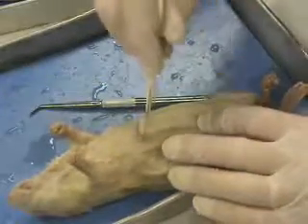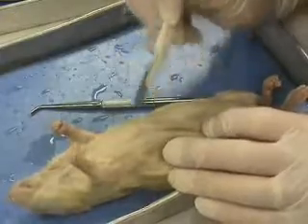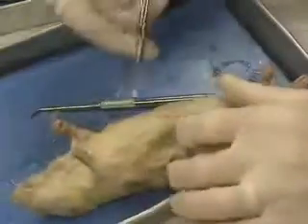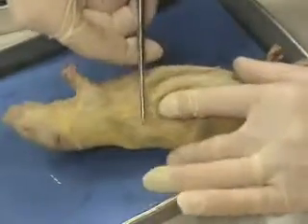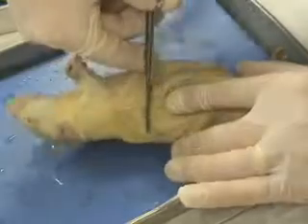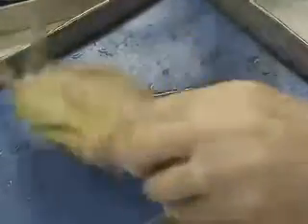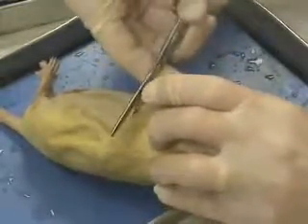and I'm going to make an incision. That incision is just a poke right underneath the skin. We're not going to go too deep, otherwise we'll cut some of the organs underneath. And using my scissors here, I'm going to work towards the dorsal side. Remember, we talked about dorsal yesterday, and we're going to work all the way to the back on one side and all the way to the dorsal side on the other.